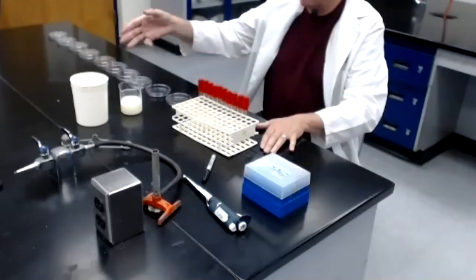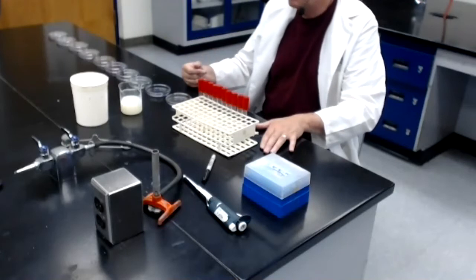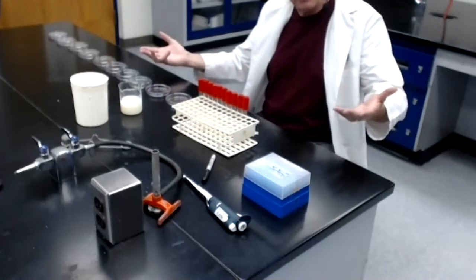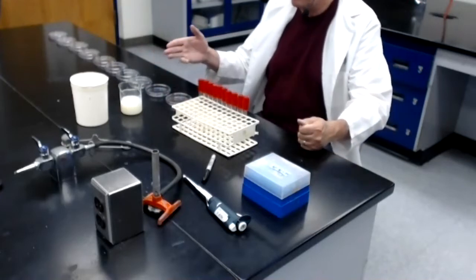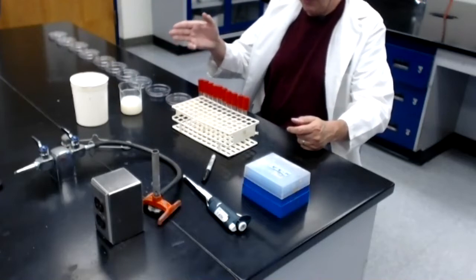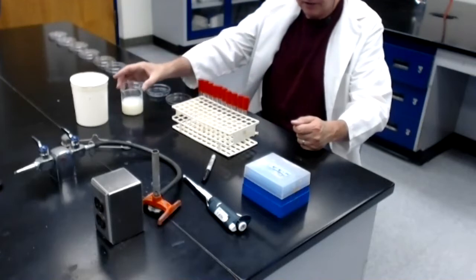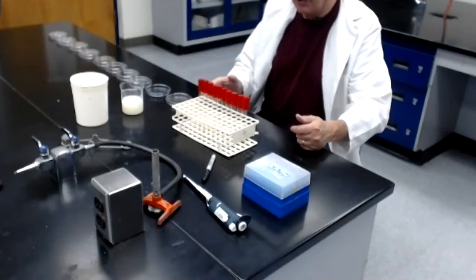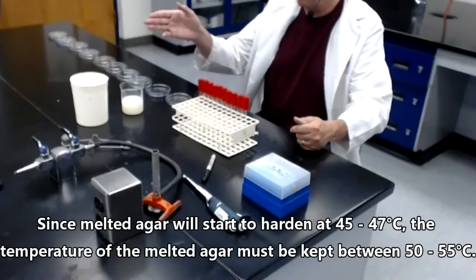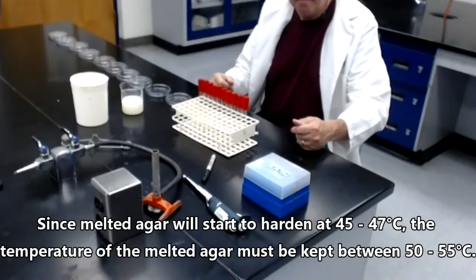As I mentioned earlier, the agar is being kept at 55 degrees C, so it remains melted until we need to use it. You might say, why did I choose 55 degrees C? Why didn't I keep it at 70 or 80 degrees C? Well, the problem is you have to use the agar at a temperature that will not kill the bacterium you're trying to count. And the bacterium in this milk cannot survive exposure to temperatures above 55 degrees C. So it's important that the temperature of the melted agar is no higher than 55 degrees C.